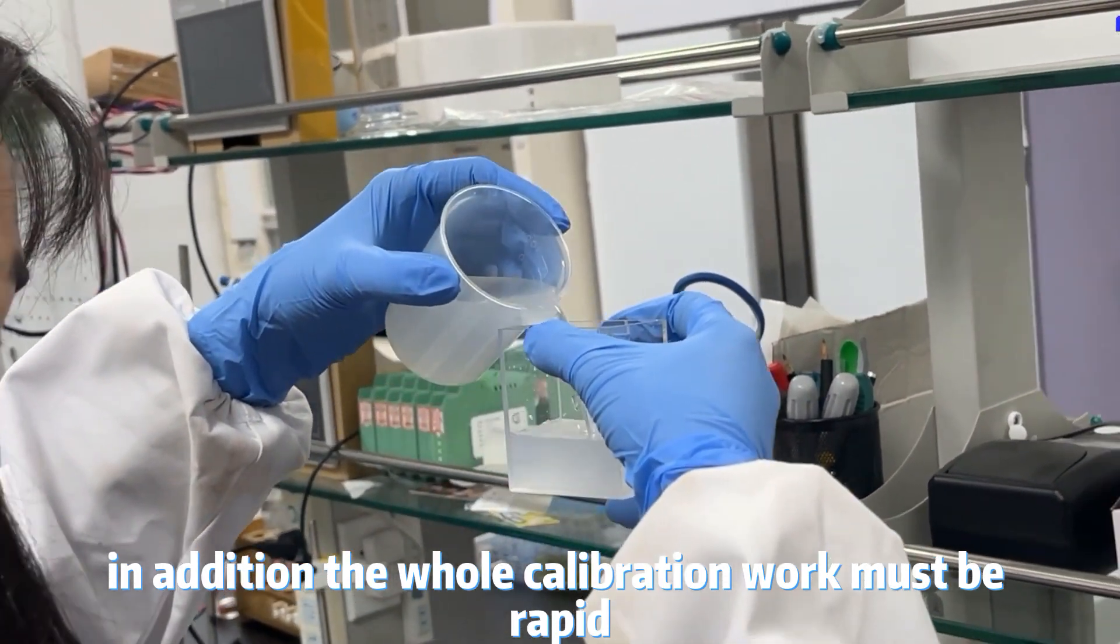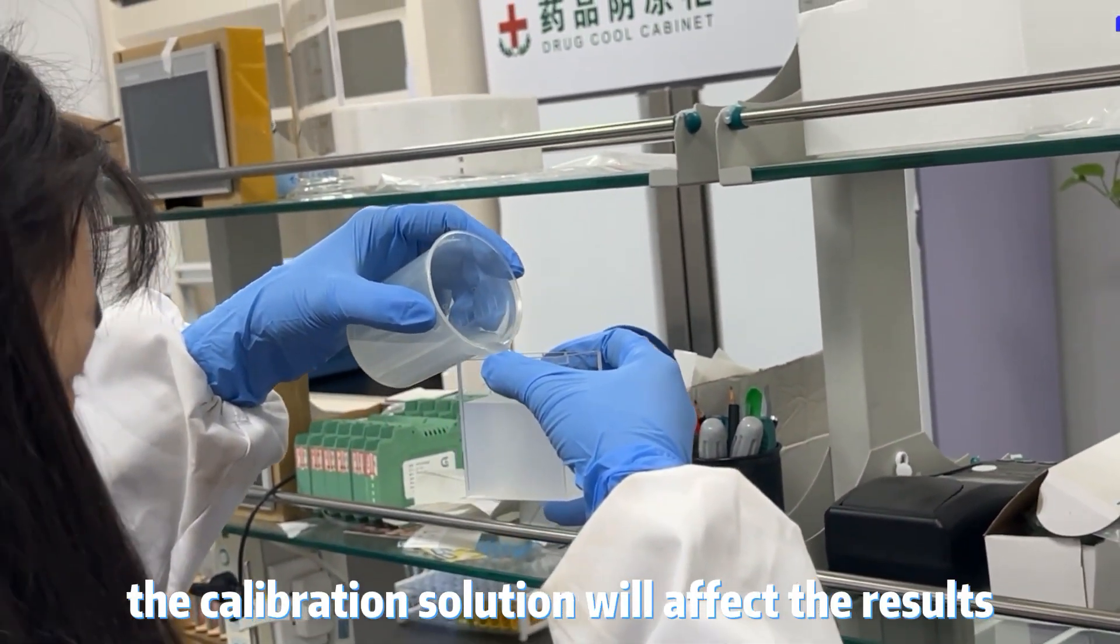In addition, the whole calibration work must be rapid, otherwise the calibration solution will affect the results after precipitation.